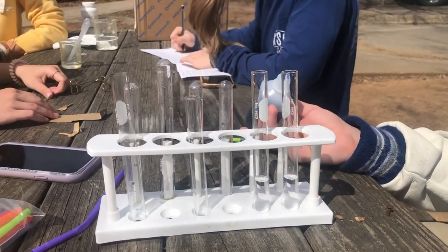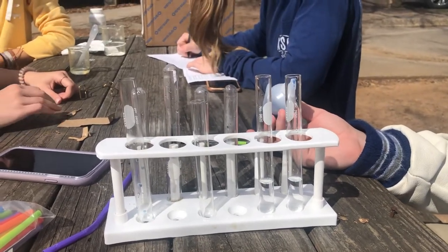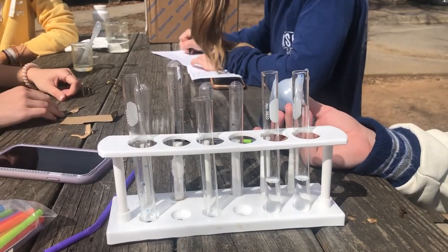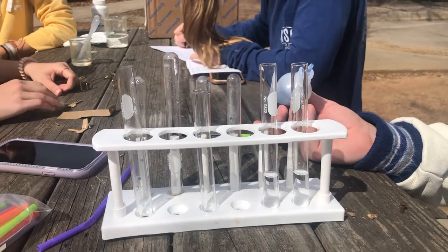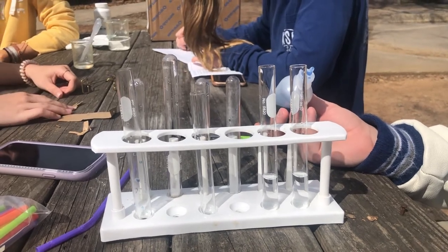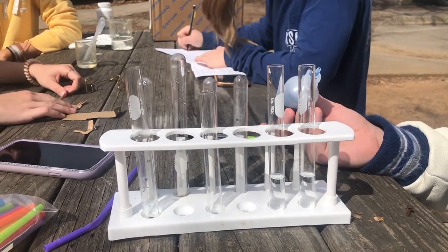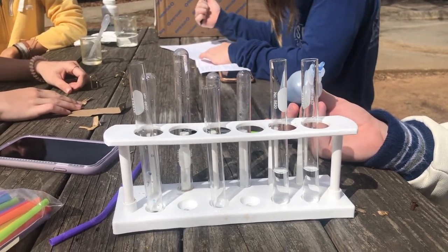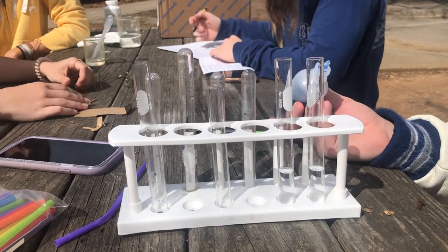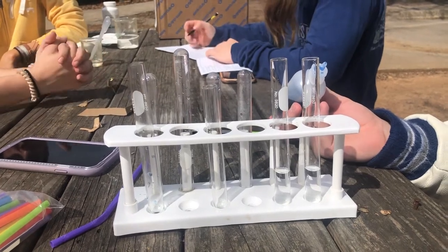Some of you aren't going to be able to be with me for your acid rain experiment. So we're going to go through a couple of demonstrations here that you would have performed in the lab if you were here.